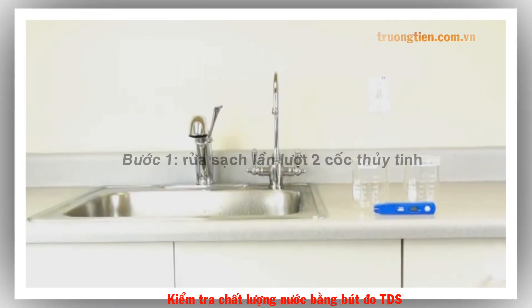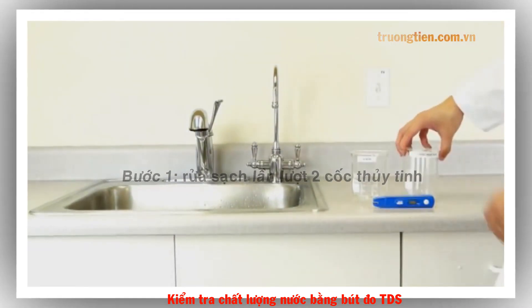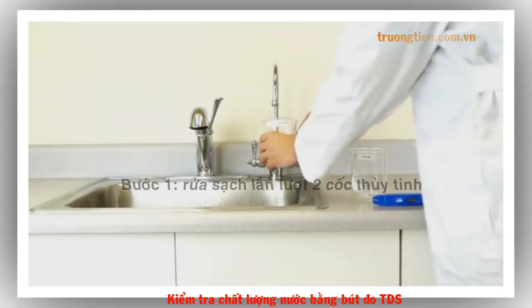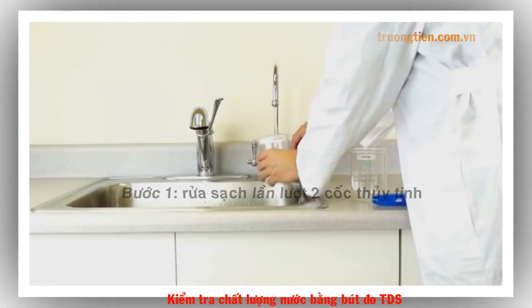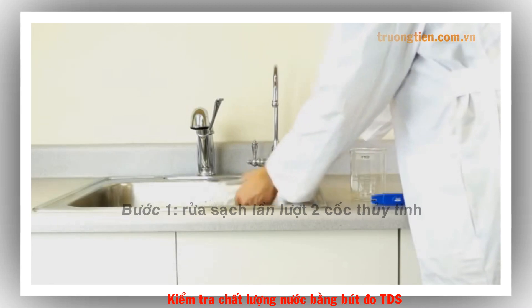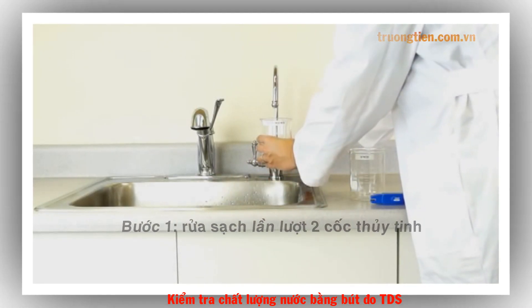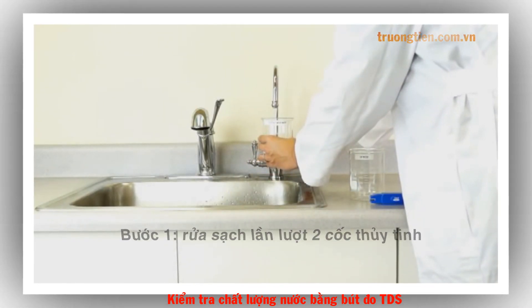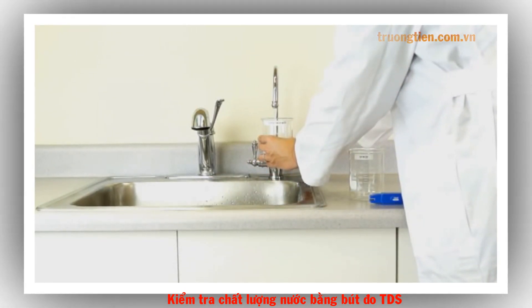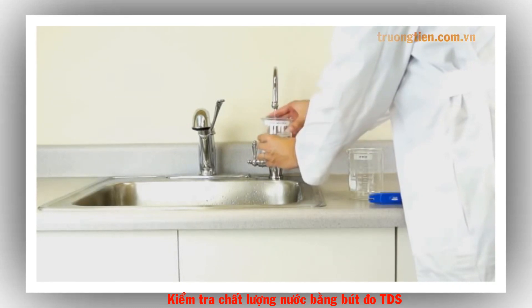To begin, first rinse two cups with reverse osmosis water. Then fill up the first cup with RO water and the second with tap water.